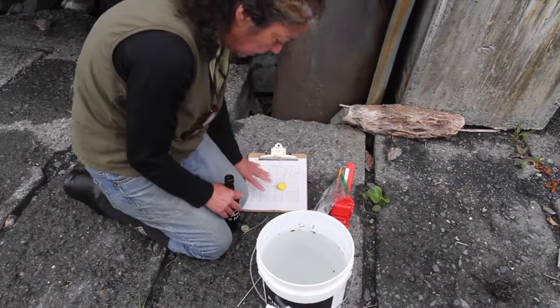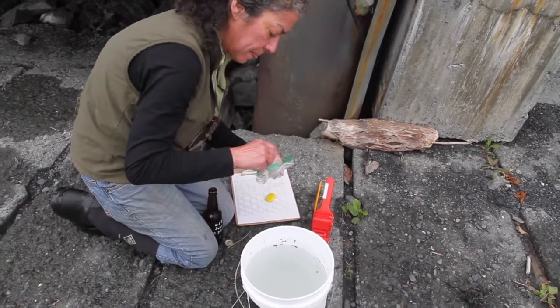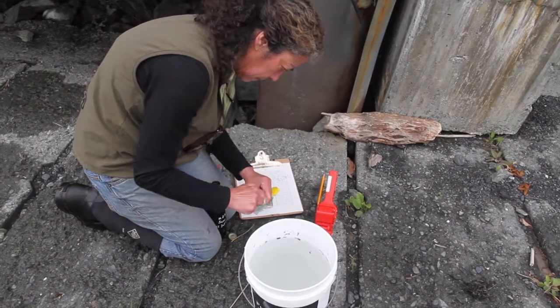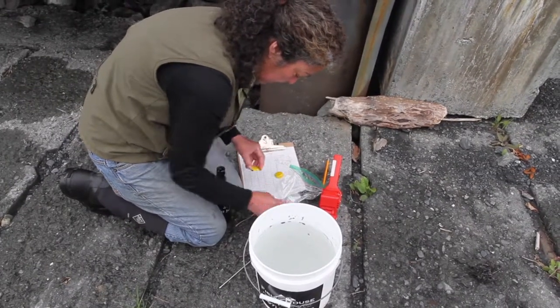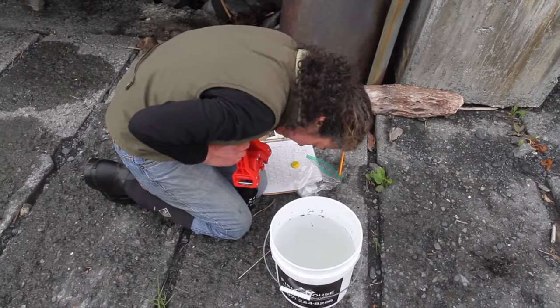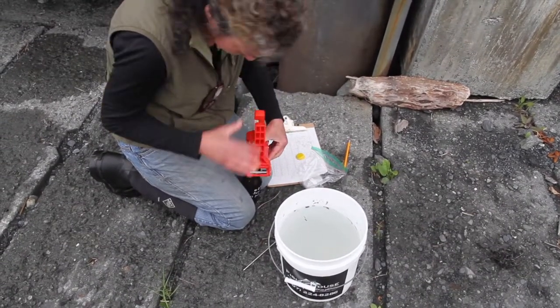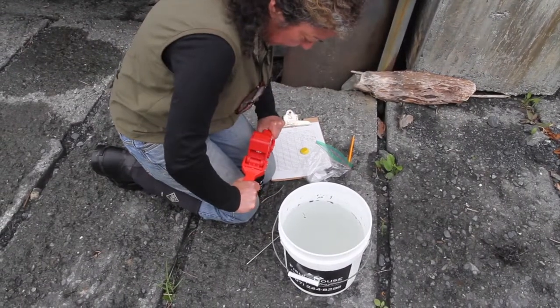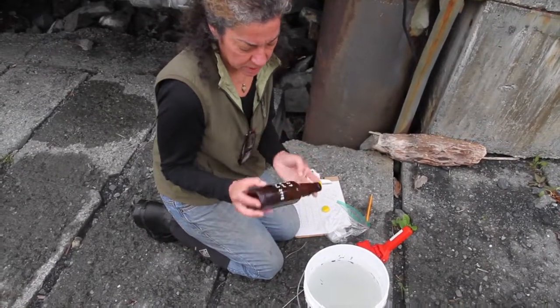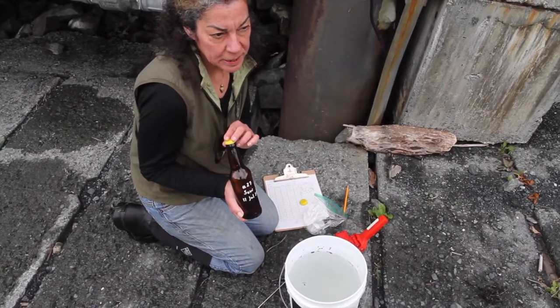I'll cap my bottle after I fix it with one drop of fixative from my dropper bottle. Then I'll place a fresh cap on the bottle, push it down firmly, and the bottle is now capped. We'll go ahead and invert it to mix the fixative. Now this seawater sample is shelf stable until I can analyze it in the lab.